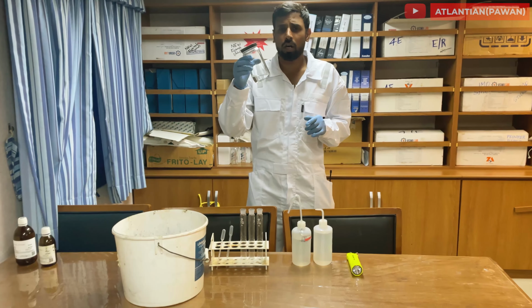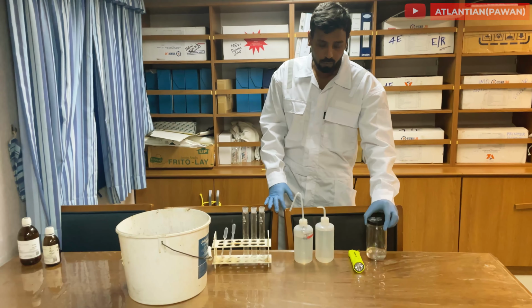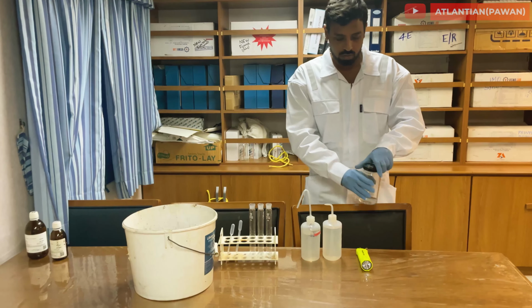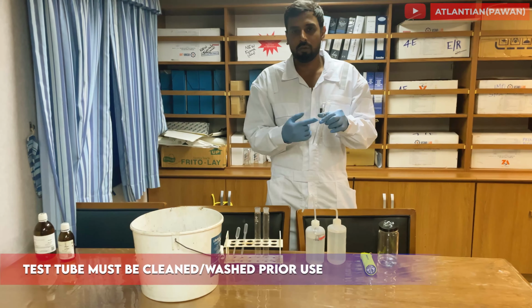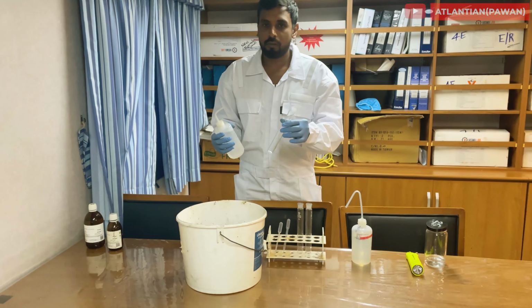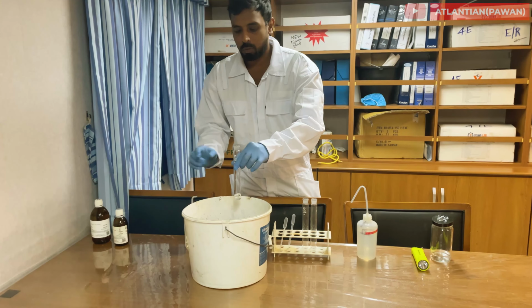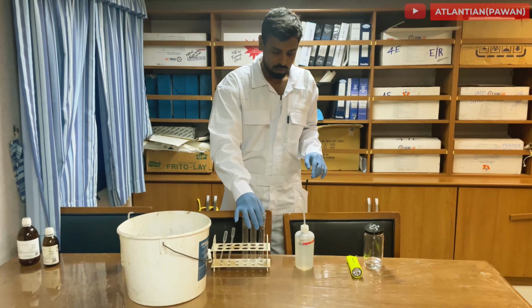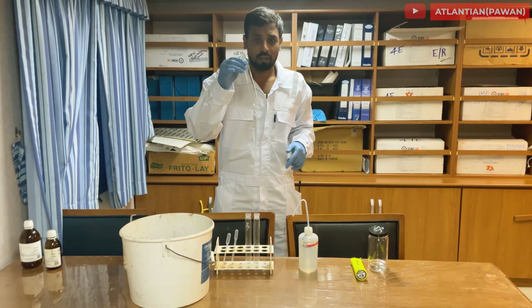So at least 50 ml or 100 ml of methanol sample from the tank is required. So that's what I've already brought. Now I'm going to test this in my tubes. Make sure all the tubes you are using are already washed with methanol. They are clear. The tube itself is not contaminated. So rinse it properly with methanol. Make sure there is no discoloration or anything present on the tube itself.